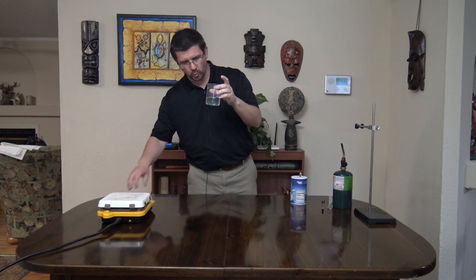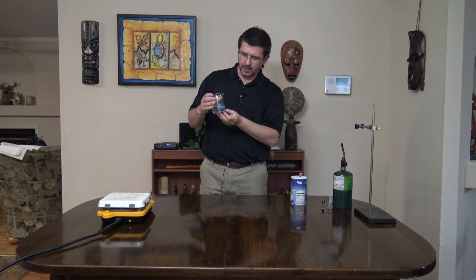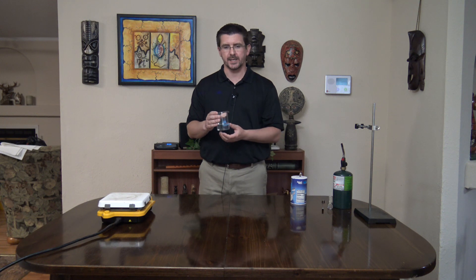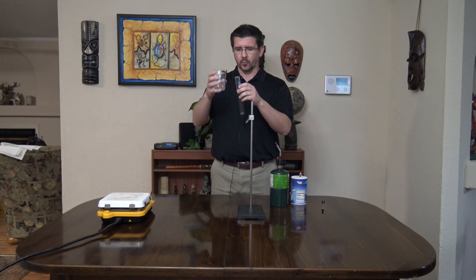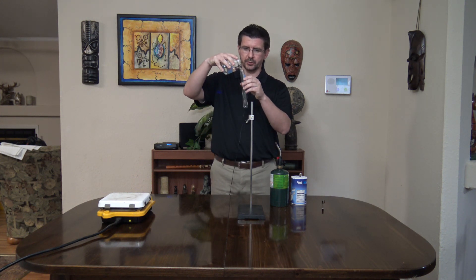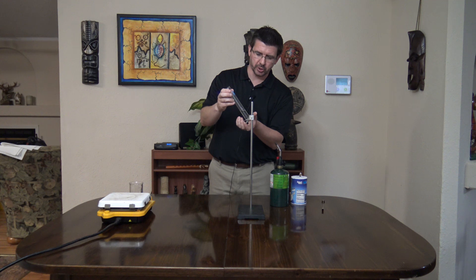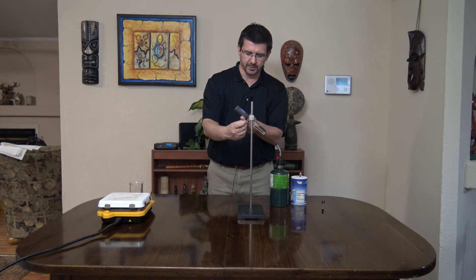We're going to show you why this is a physical property and not a chemical property. In order to do that, we're going to take our salt back out of the water through another physical change — a change in state. The goal of this solubility demonstration is to get the salt back out of the water without having a chemical reaction. To do that, we're going to pour some of this salt water into our test tube here. All we've got to do is heat this enough to boil the water out, leaving the salt behind. That'll show you that the salt was in there all along and that there was not a chemical change that took place.